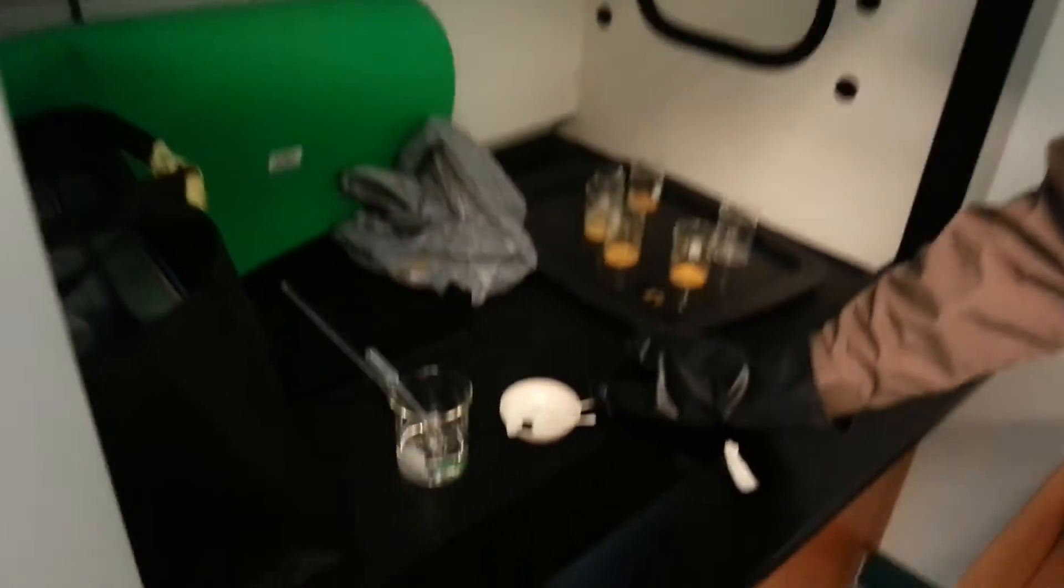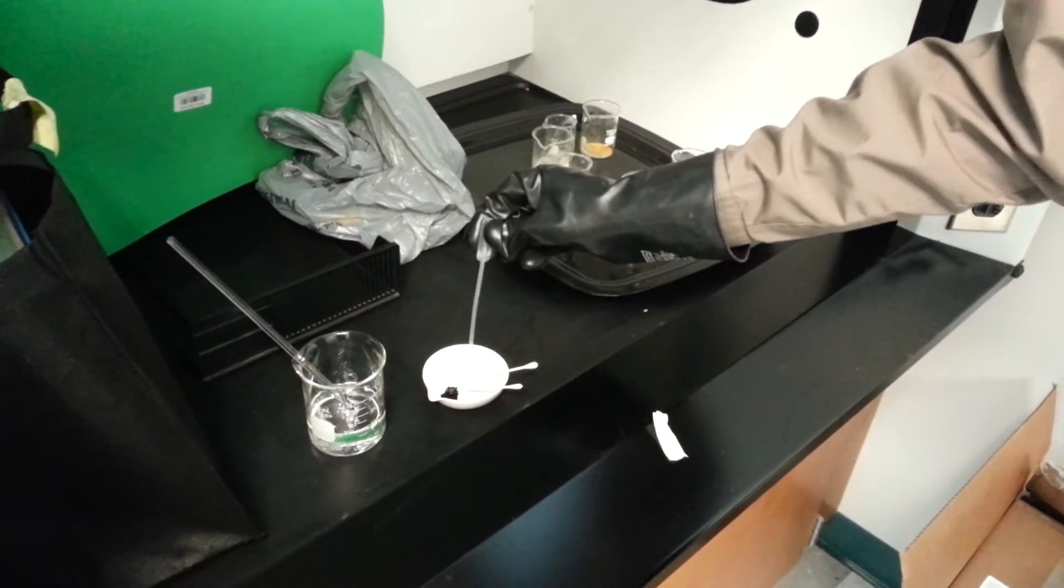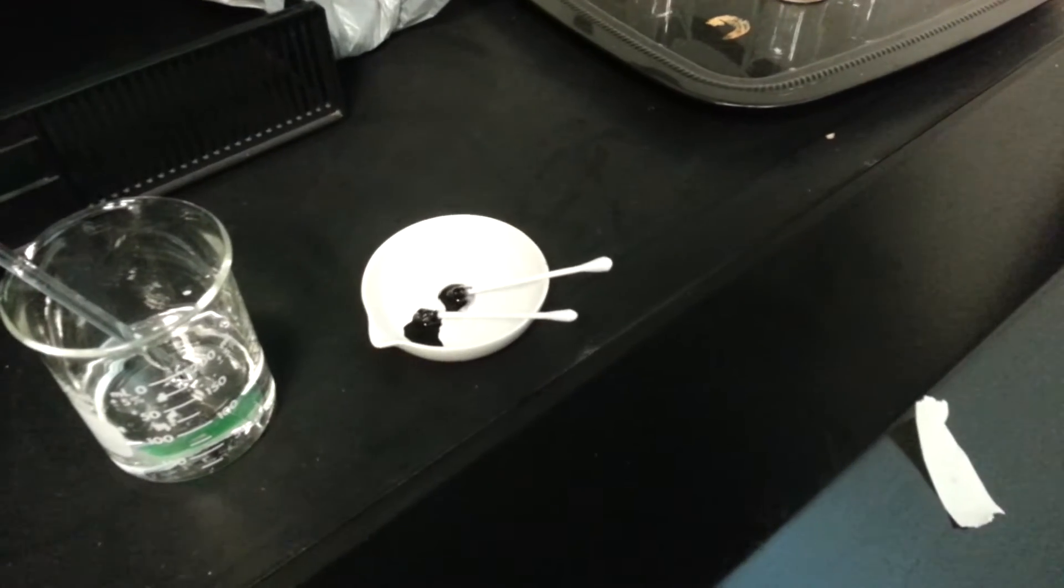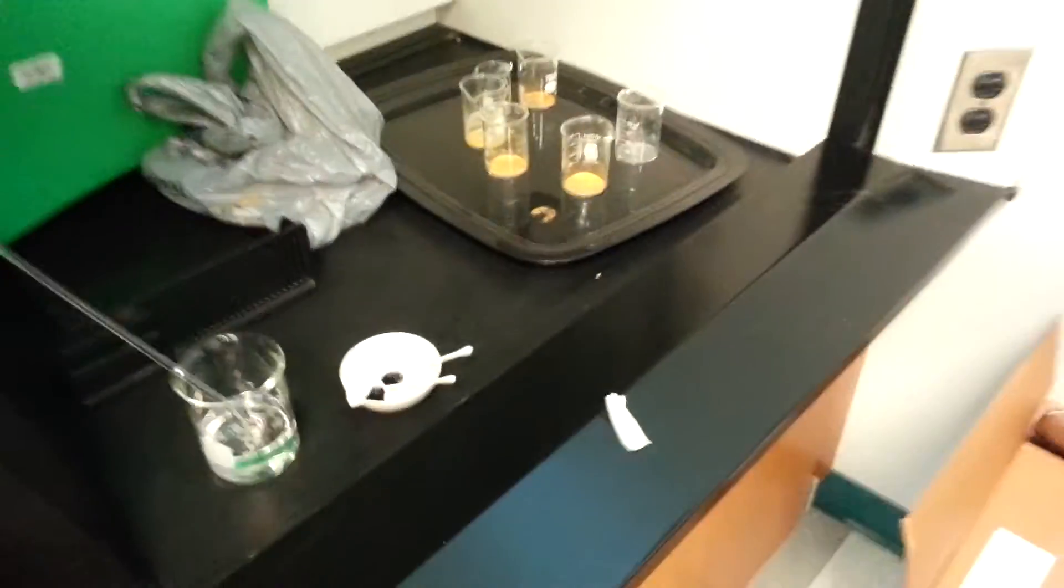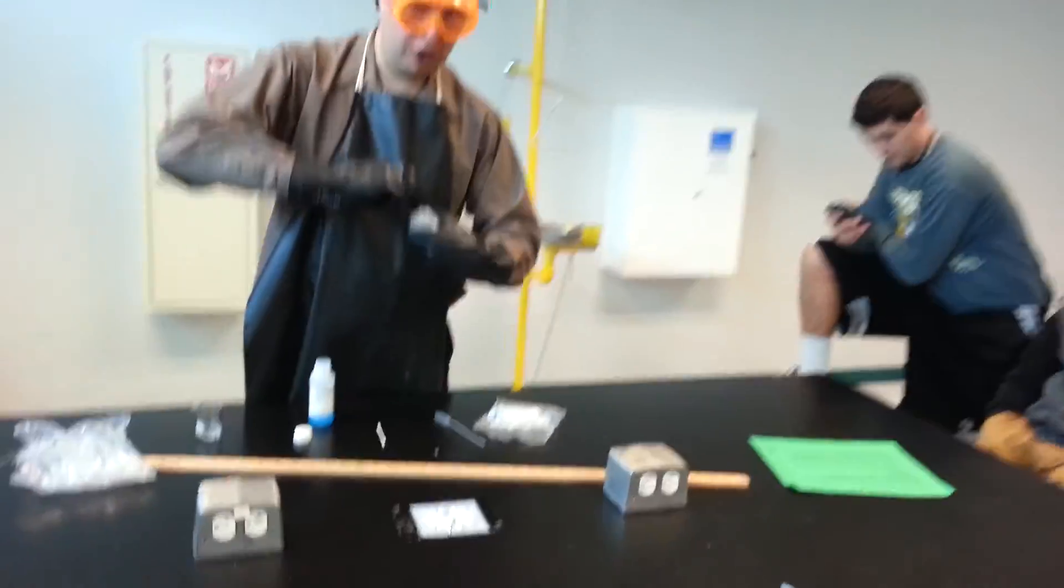I'm doing this under the fume hood because we don't want the acid to hit us. You notice the one on the right, also a black color change. That means that the lead nitrate also tests positive for gunpowder nitrates.